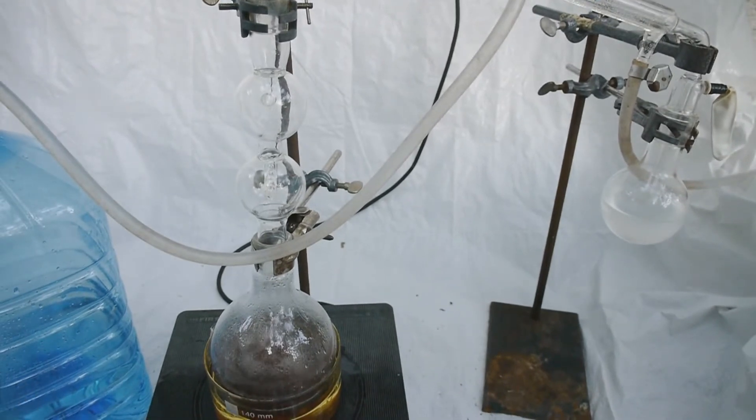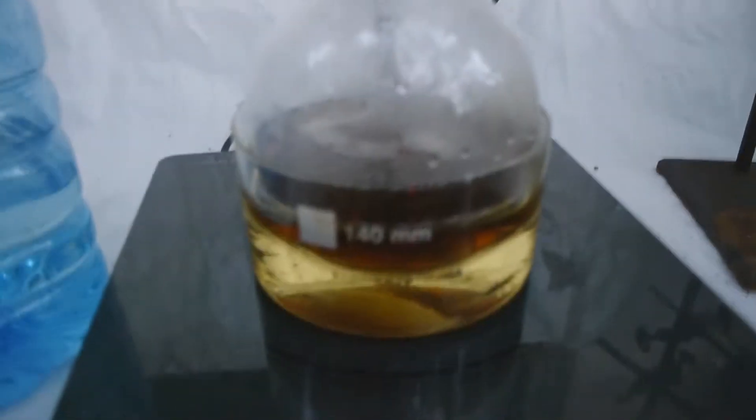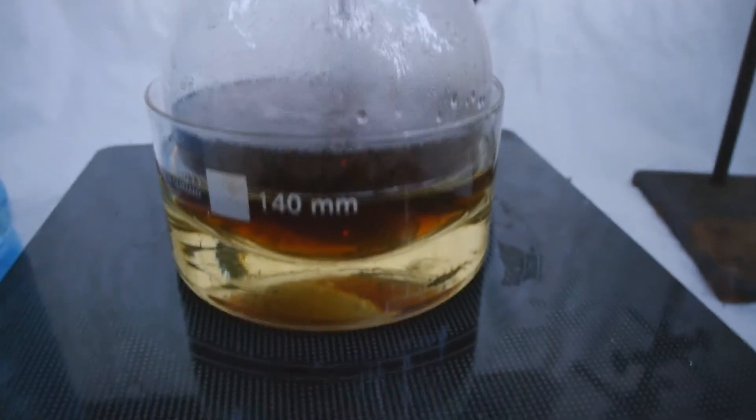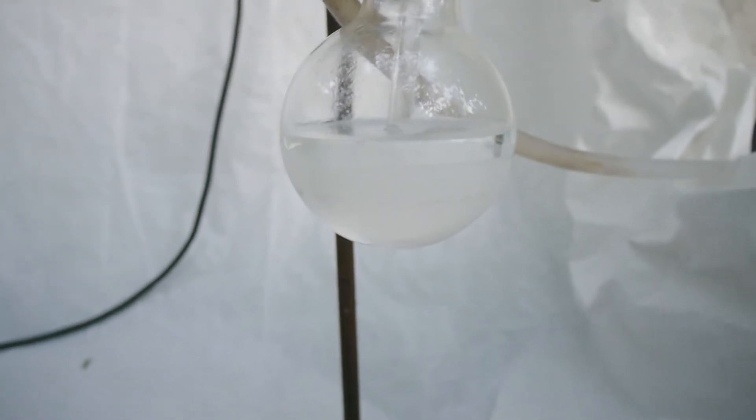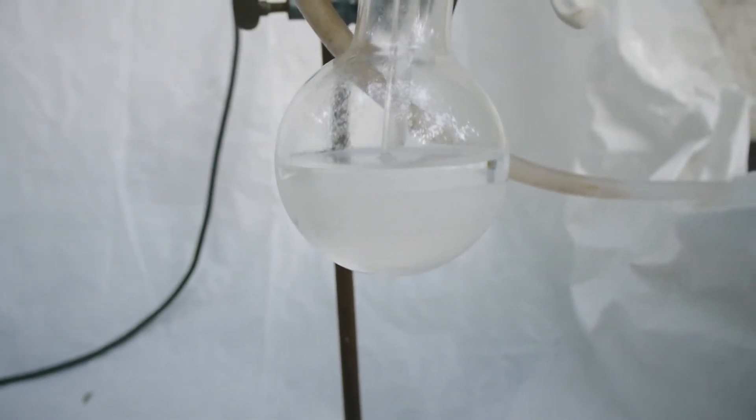The distillation is going along very nicely. All of the sodium bromide has managed to dissolve into the liquid. Also, we've collected at least 100 milliliters of product already.